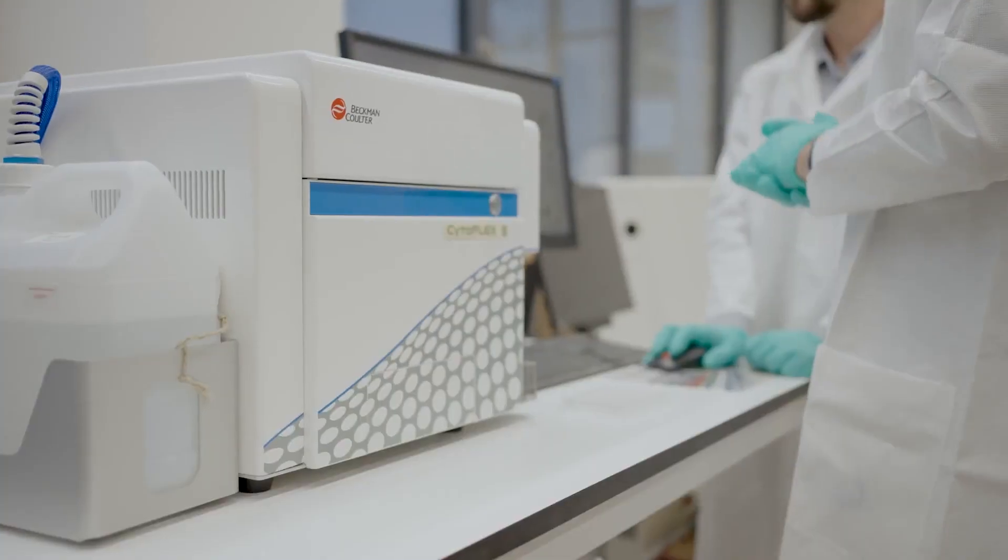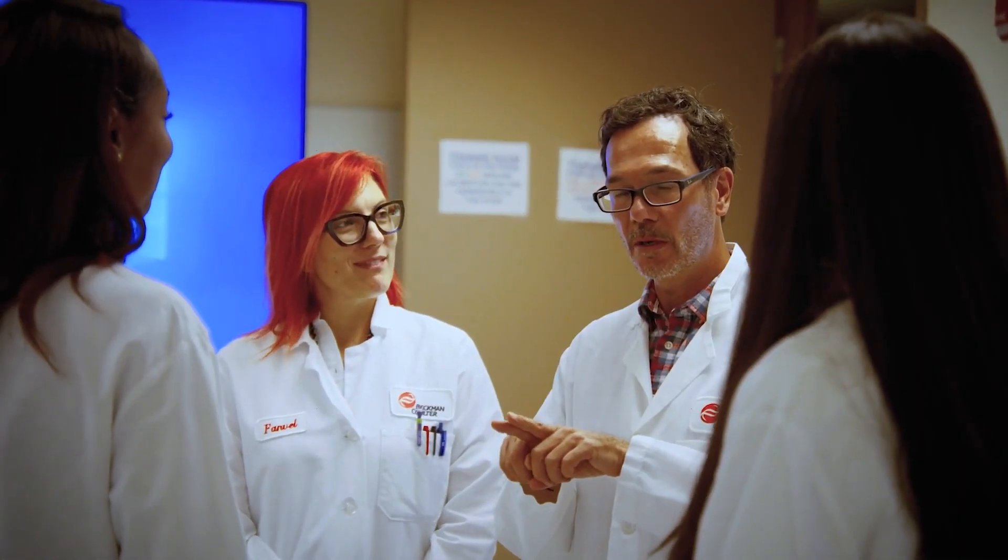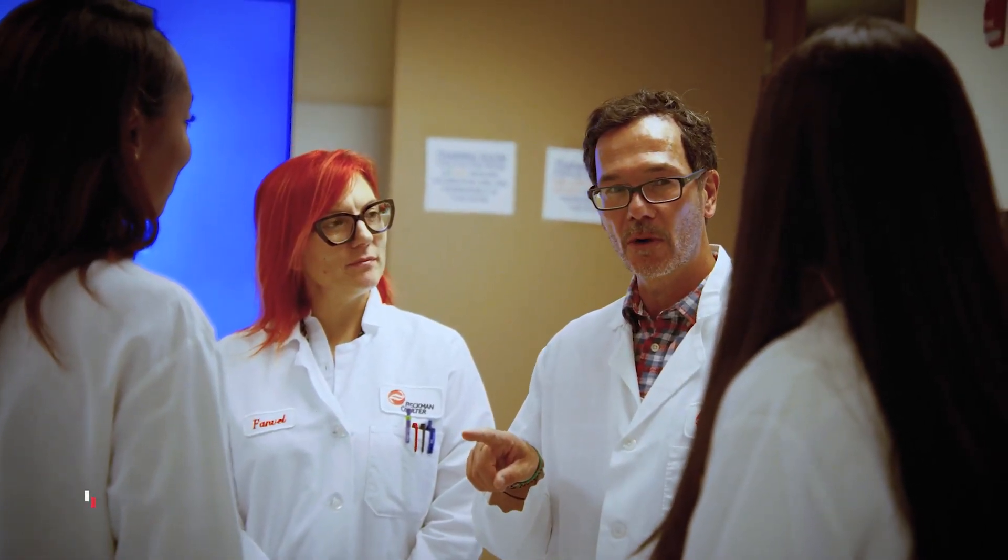Additionally, CytoExpert for Spectral stands out as one of the fastest and most user-friendly options available. It's a benchmark in the field, balancing simplicity, functionality, and performance. The software offers flexibility in spectral unmixing, allowing users to choose between different algorithms to cater to a variety of research needs. CytoExpert Spectral software offers two different algorithms: LSM and a new Poisson hybrid that has shown to reduce signal spreading, enhancing data quality. An automatic unmixing check of all the plot combinations will be generated to show if there is any issue, pointing out exactly where to aid you with your experimental troubleshooting.